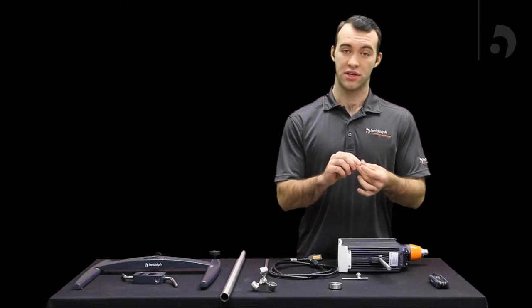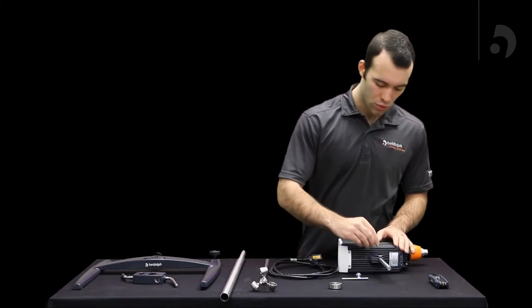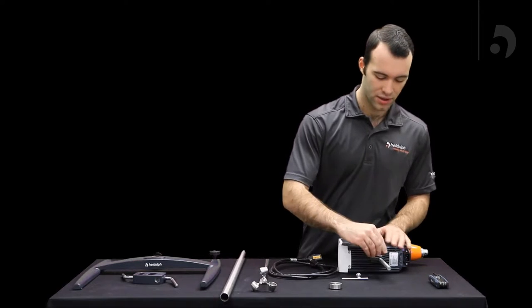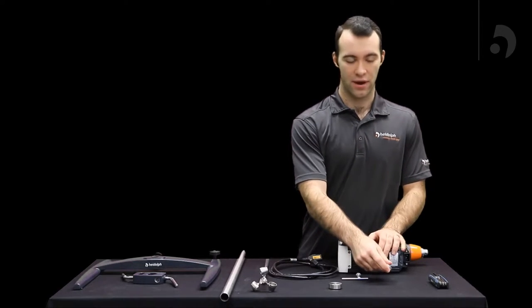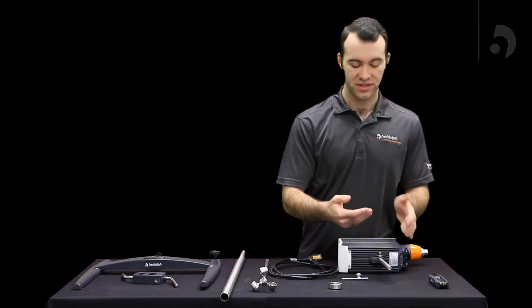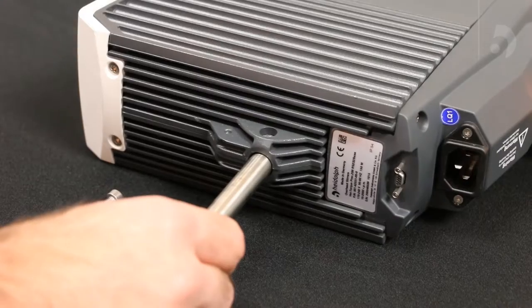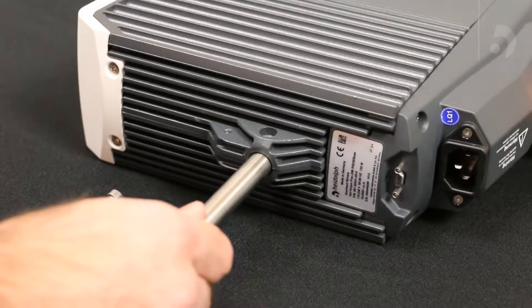Also coming with it is a screw with a Torx head which you can insert from a hole which will lock the support rod down. If you find that the screw isn't getting in you can flip the rod around because it has holes on both ends.